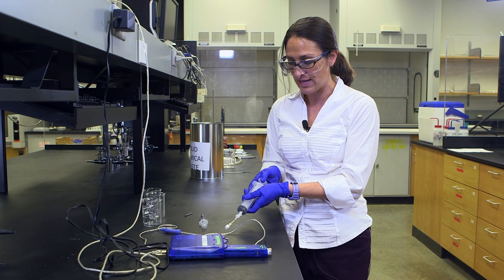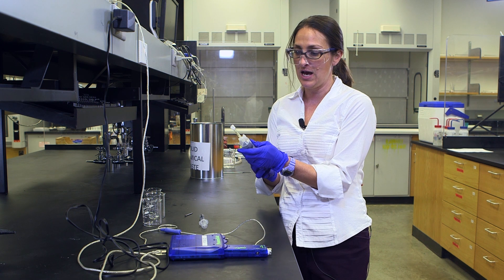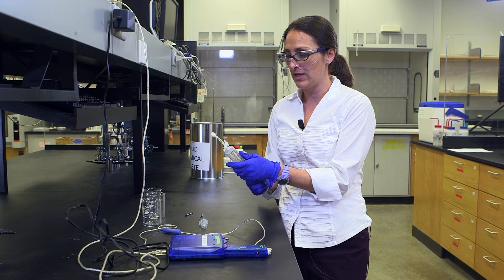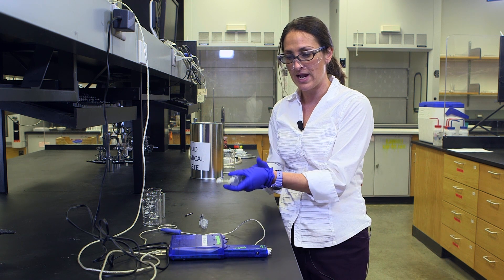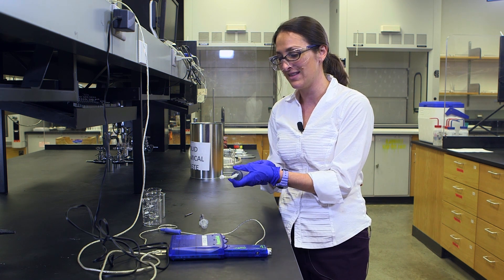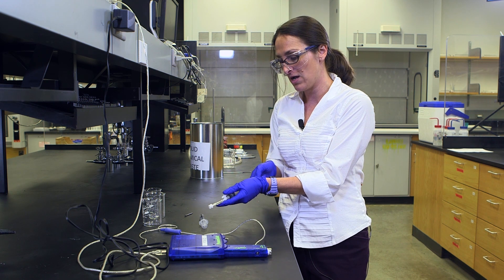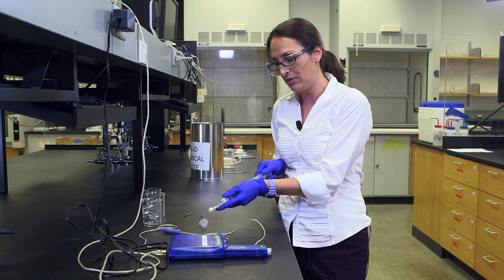Then you're going to take a sample of gas. It could be 80% nitrogen, it could be atmospheric. It could be, if you have some dry ice—you should have dry ice in the lab—if you wanted to get some carbon dioxide subliming off of that dry ice, that's another option for a sample.